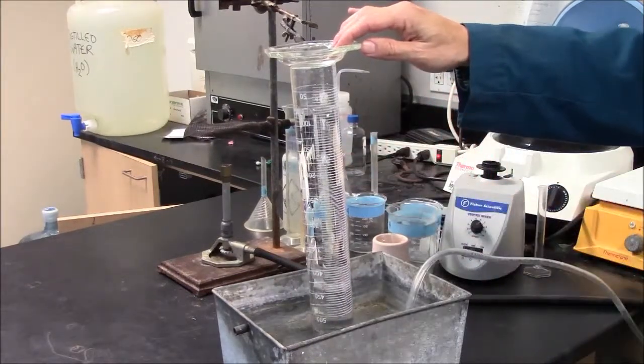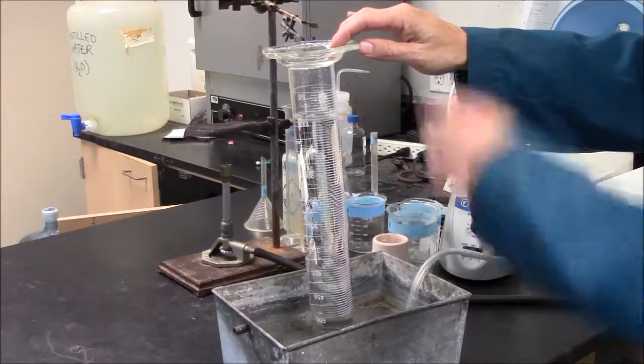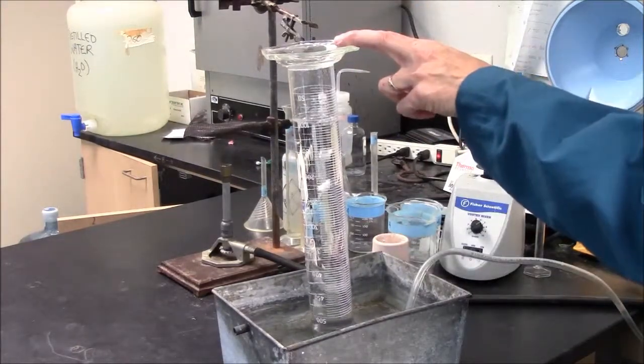During the actual contest this will be a timed reaction. You have up to three minutes to collect your gas. So the reaction rate may be important.